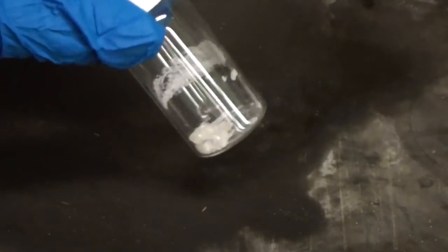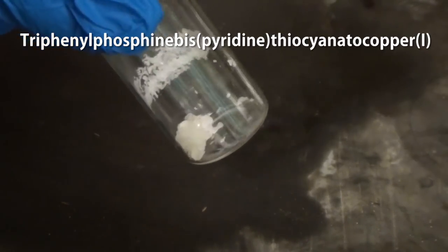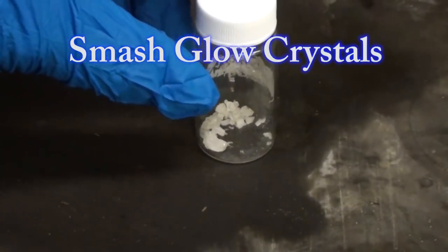And here we have it, dry crystals of triphenylphosphine bispyridine thiocyanate copper. As I like to call them, blue smashed glow crystals.